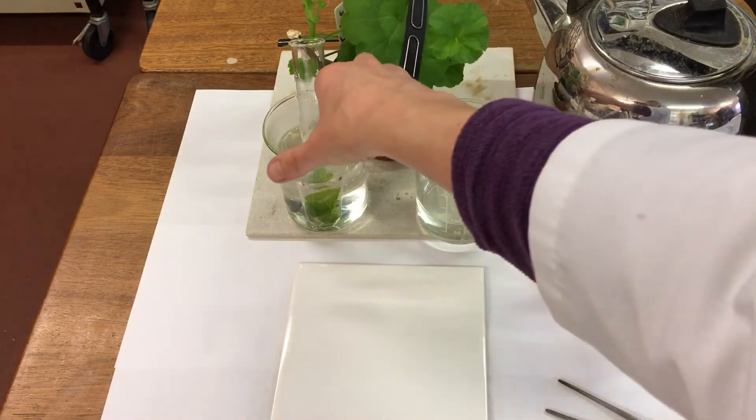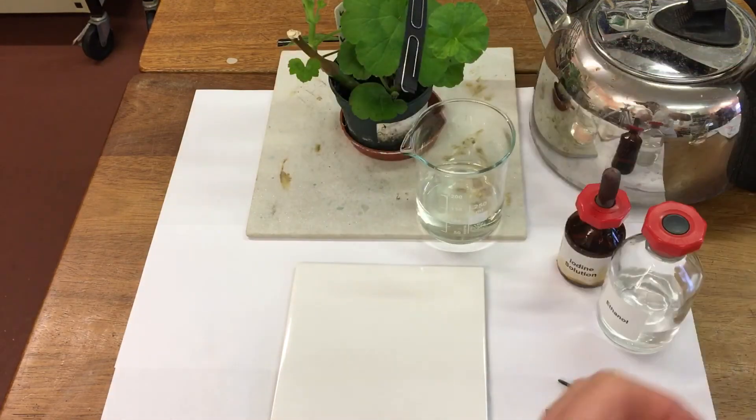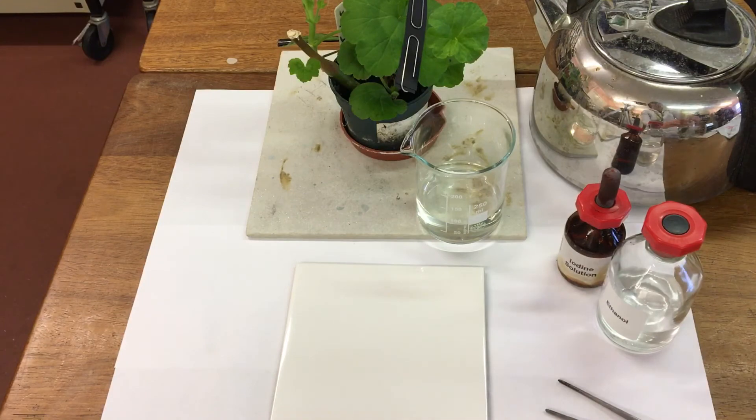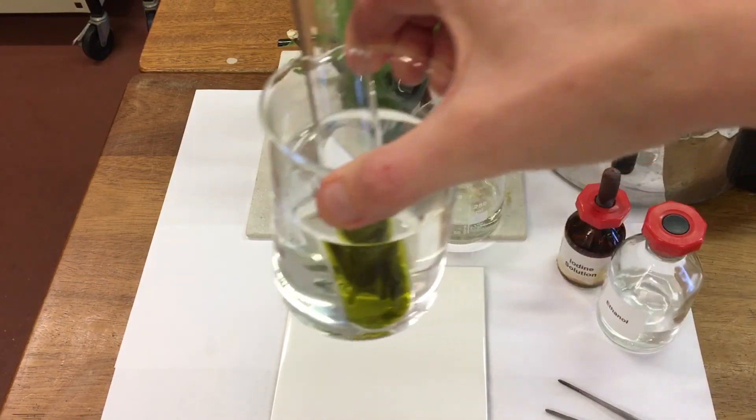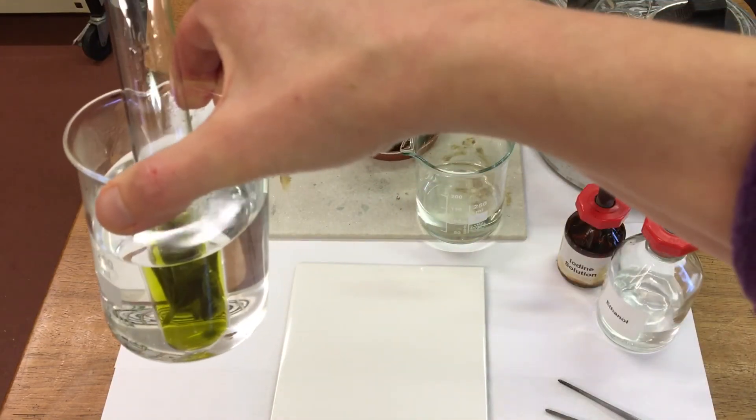So after 10 minutes, you can see the colour of the ethanol is completely green.